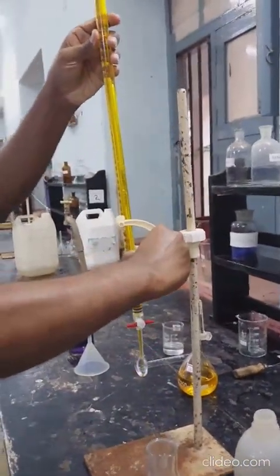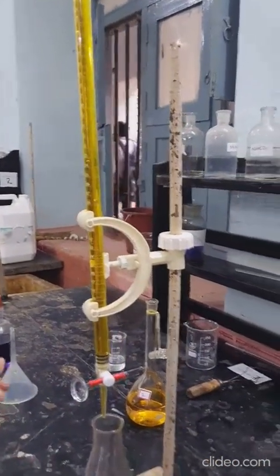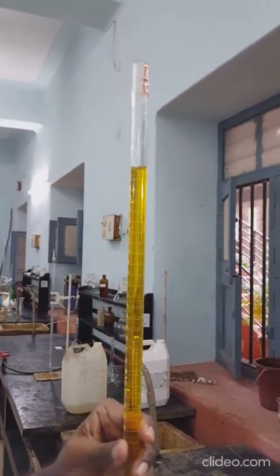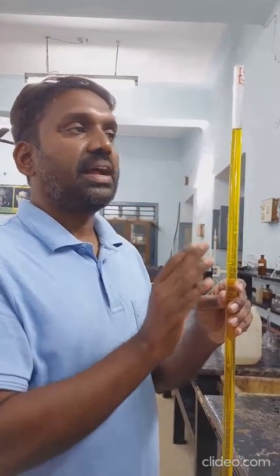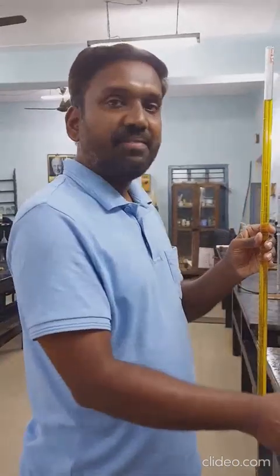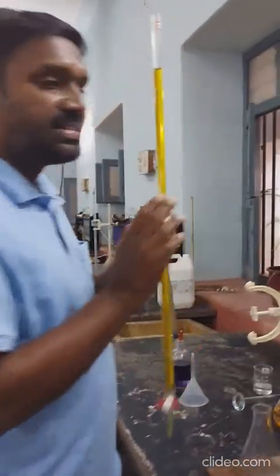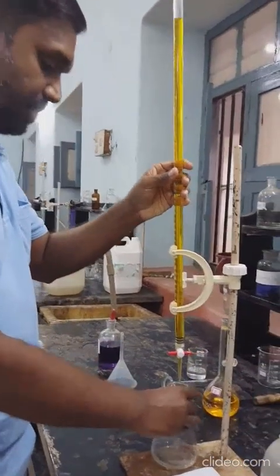Now you can start the titration. Make sure just before the start of the titration that the initial burette reading is noted down in your observation. Even though you have already adjusted it to zero, whenever you start the titration, the initial burette reading should be noted down, because it is always possible that in the meanwhile, while you are not titrating, the burette can leak or drip and the initial burette reading would change. Just when you begin the titration, take the initial burette reading. In this case it is zero, but it need not always be zero.